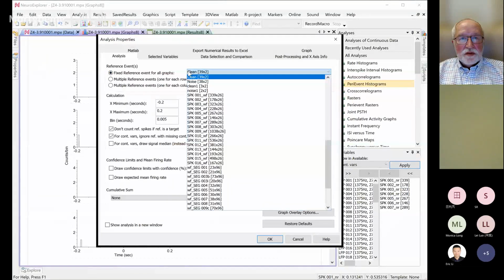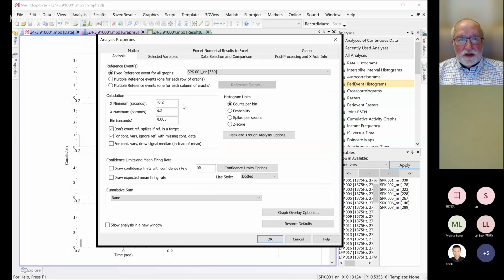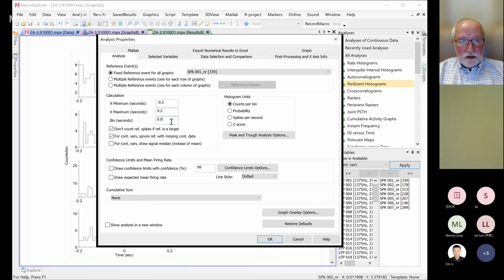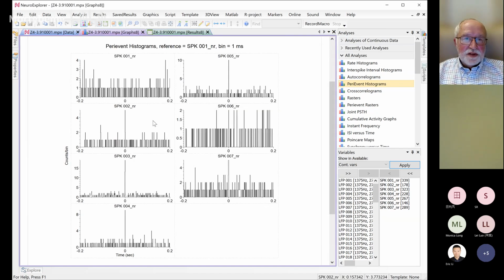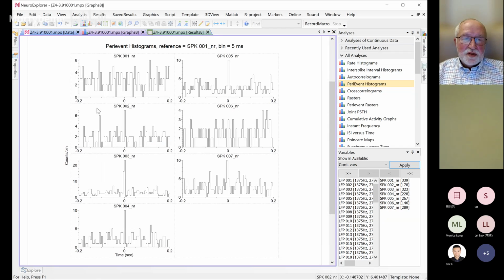Let's go back to the one that we used before. That's a bin of 5 milliseconds, and this is where we set the bin. The bigger the bin, say 20, the more spikes from 0 to 20 milliseconds after the stimulus will be in this column. Or if you want just a 1 millisecond bin, then you'll have a kind of ugly picture. Usually you want something a little bigger than 1, depending on how many spikes. If you have lots of spikes, you will get a nice curve.